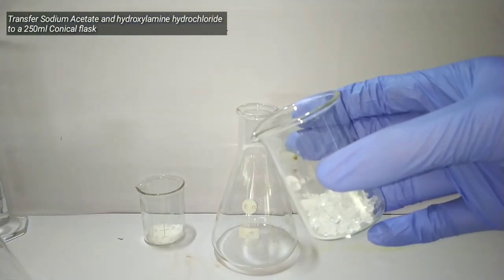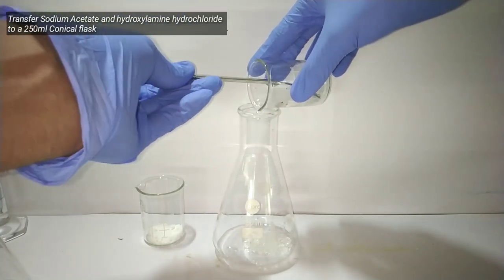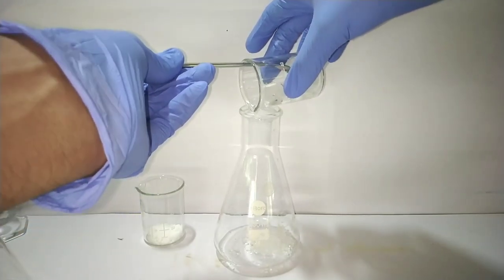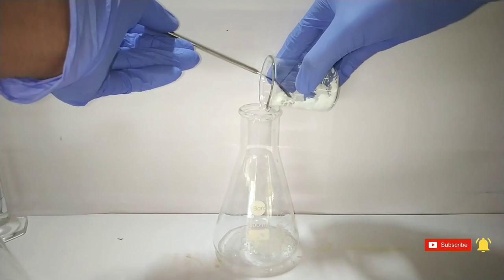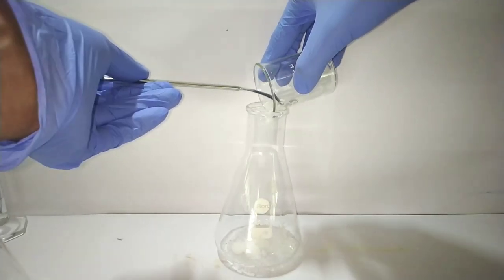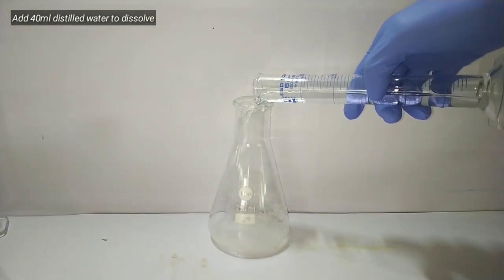Start by taking a 250 ml conical flask and transfer both the sodium acetate and hydroxylamine hydrochloride into the flask. Then we add 40 ml of distilled water to the mixture.